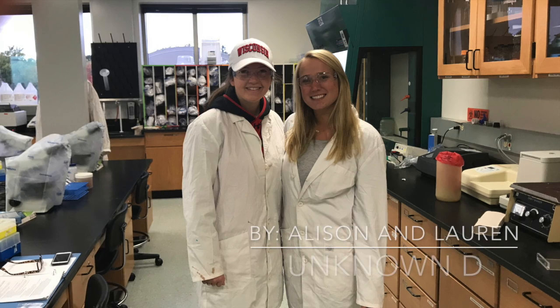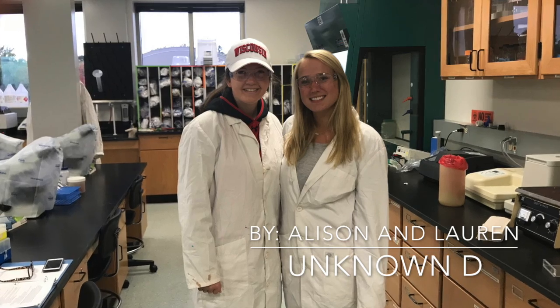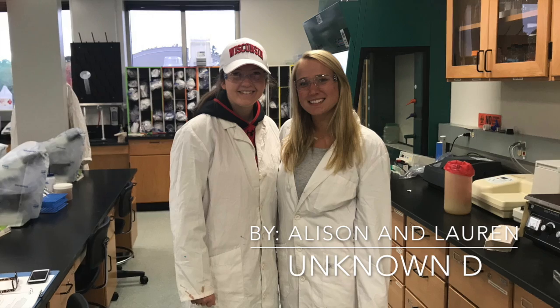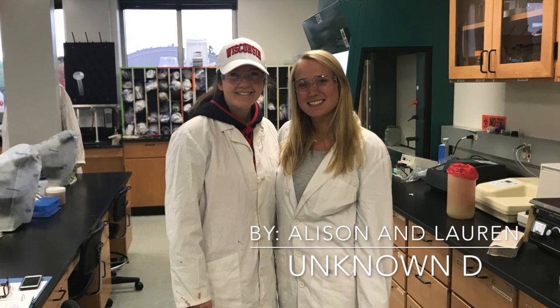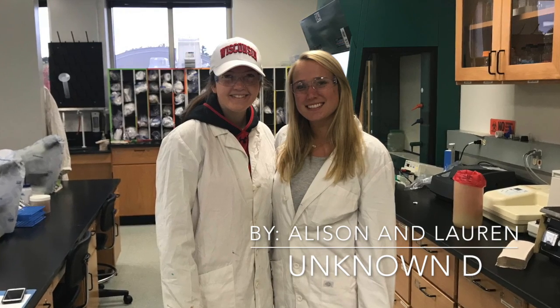Hello, this is Allison and Lauren, and we are here to take you step by step on our journey through discovering the real identity of our unknown bacteria D. We generated a dichotomous key based off of the chart that was provided to us, which included test results of all potential candidates for our unknown.